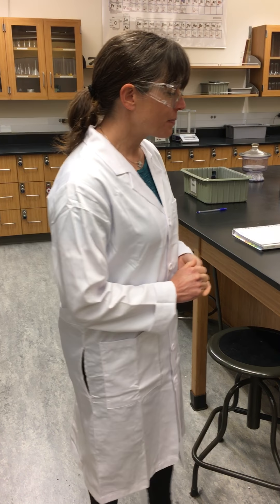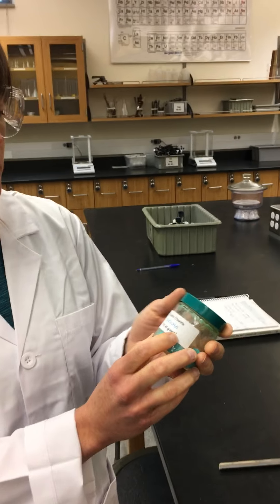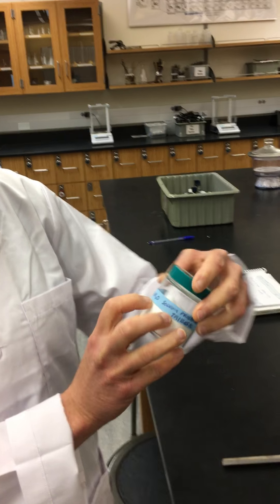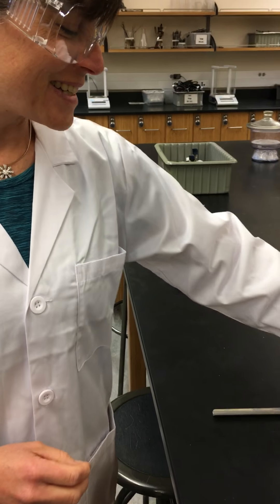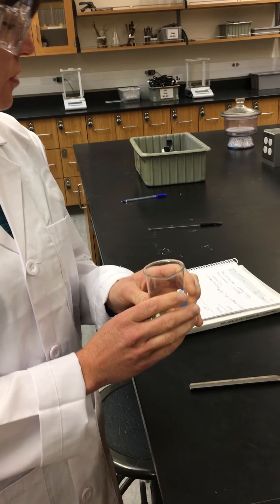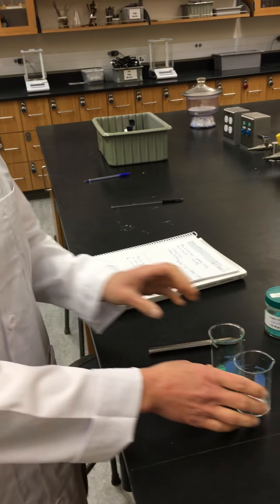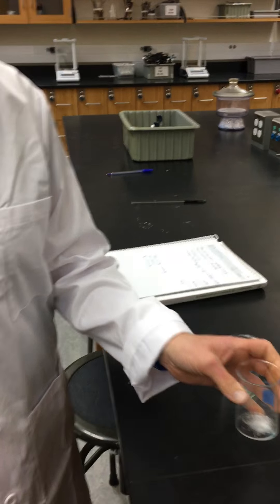The beginning part of this experiment involves taking copper 2 chloride dihydrate and sodium phosphate with 12 waters. We have pre-weighed out 0.7520 grams of copper 2 chloride and 0.5016 grams of the sodium phosphate.